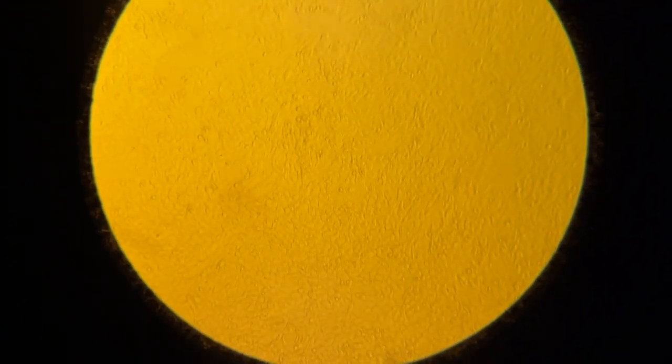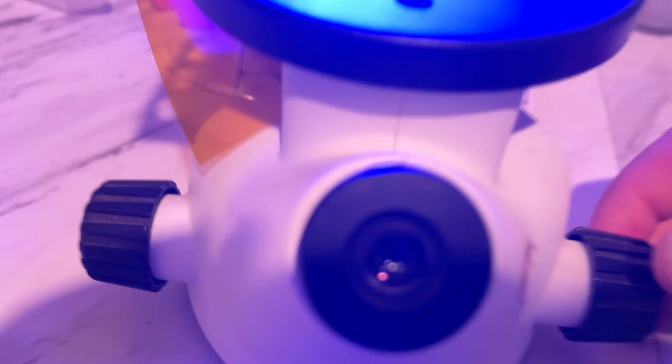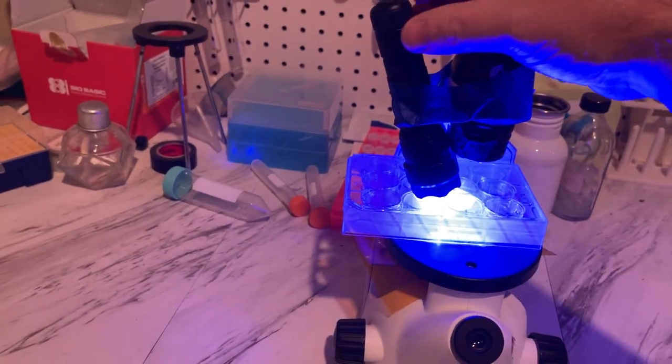And then, let me remove the light. This is modified ones. And you can see, the culture's really high. Pretty straightforward.